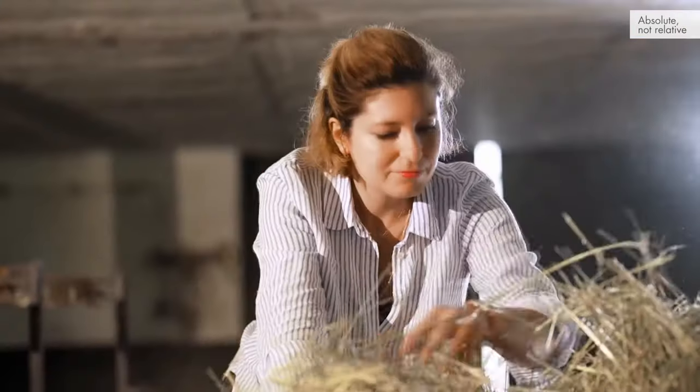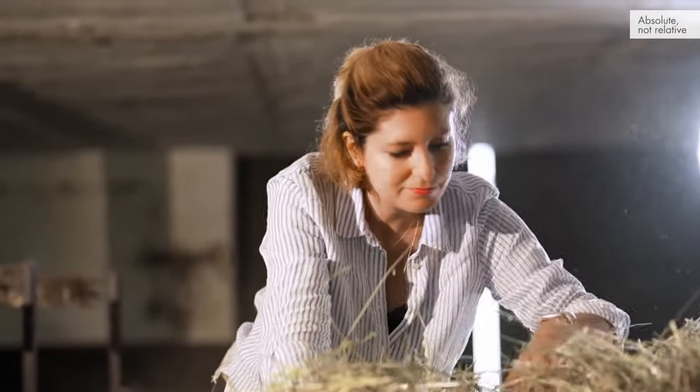What does a haystack have to do with digital PCR? Digital PCR is a great technology that will help you find the needle in the haystack.